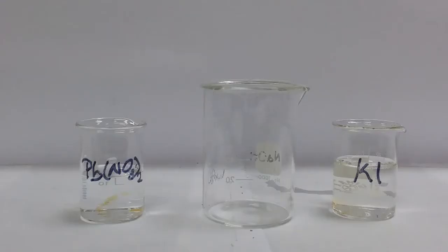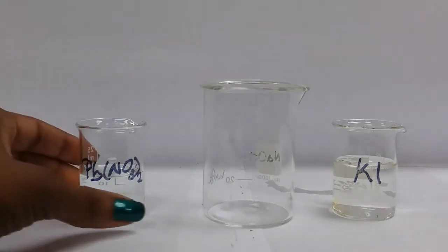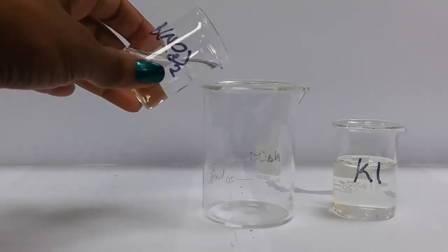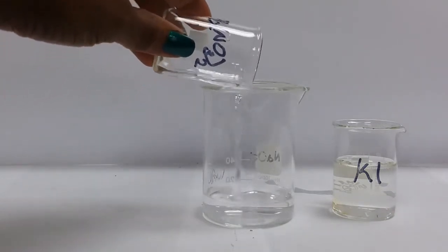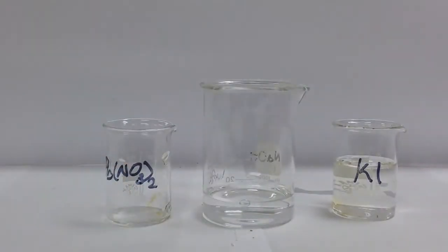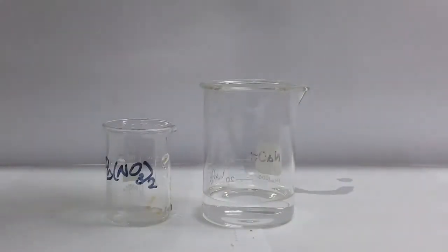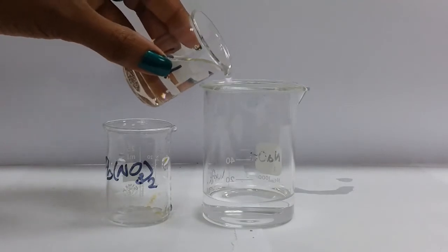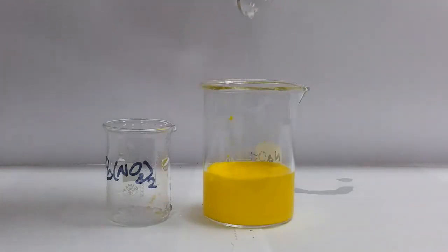So first up, we're preparing our salt by ionic precipitation. I've already measured my volumes. So my lead nitrate.